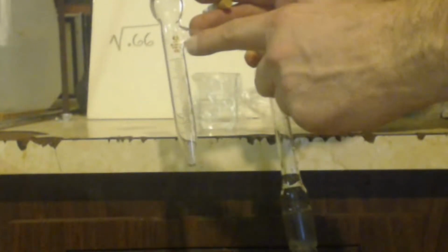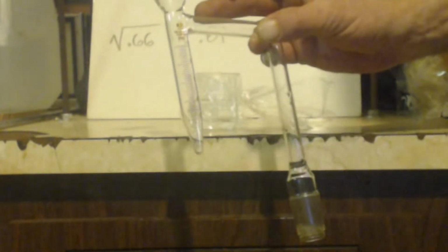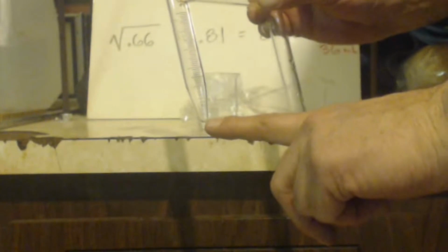Now, I lost the footage on this, but I put it in the Dean Stark and I filled up the test tube part all the way up. I let it run for like an hour or two. And the only thing it collected was like a little bead, like if you had an eyedropper and a drop, you know what I mean?